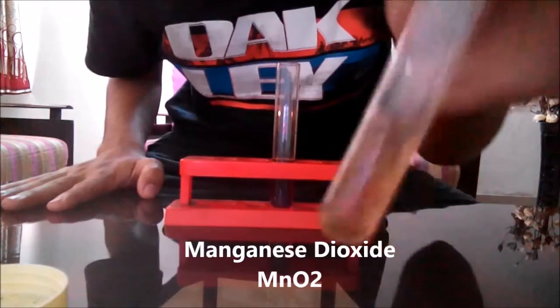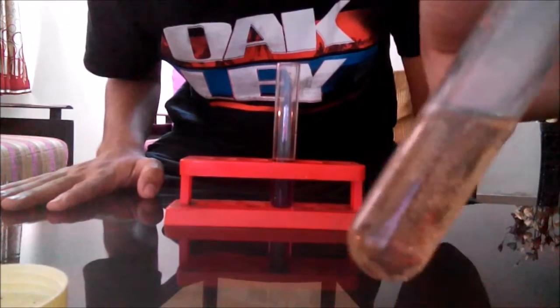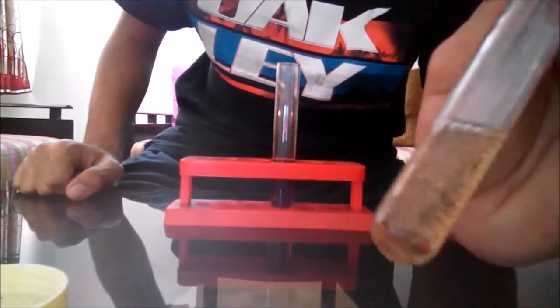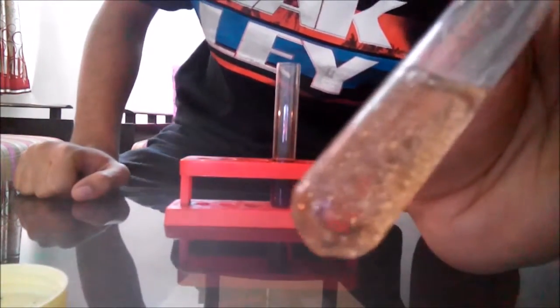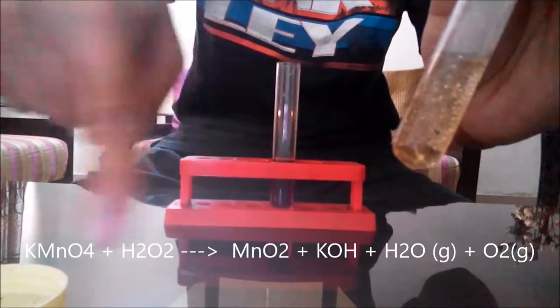You can see the yellow color is actually due to potassium permanganate being reduced to manganese dioxide. These bubbles are of oxygen gas which is being released in this reaction. Here the potassium permanganate acts as an oxidizing agent whereas the hydrogen peroxide acts as a reducing agent. The chemical equation is written below.